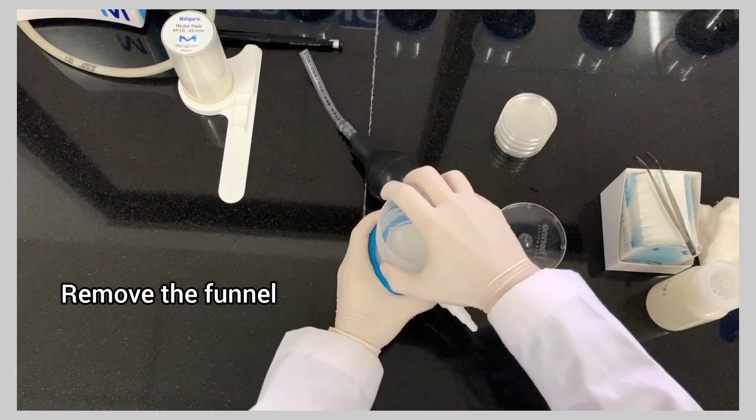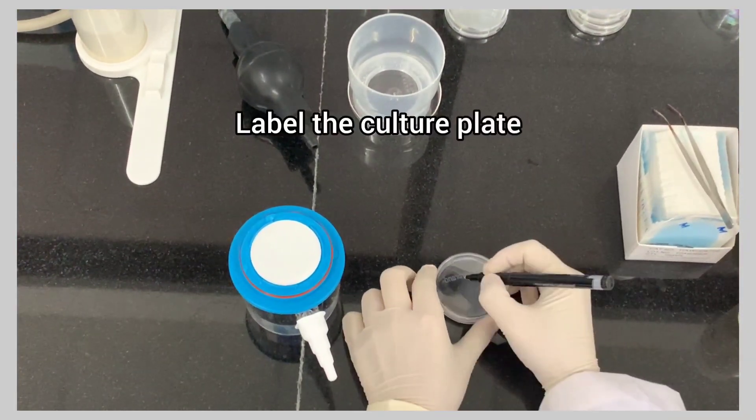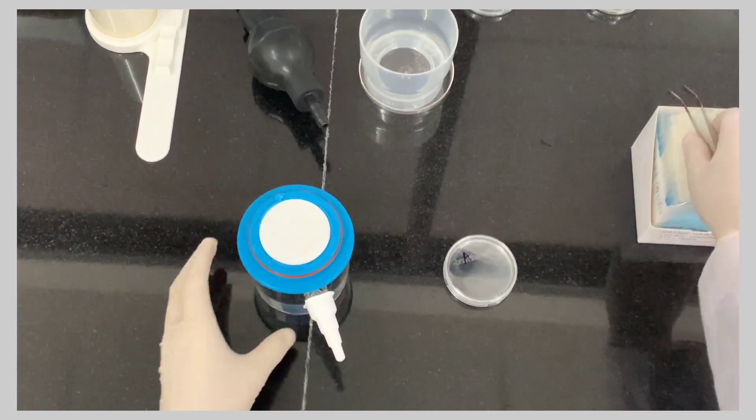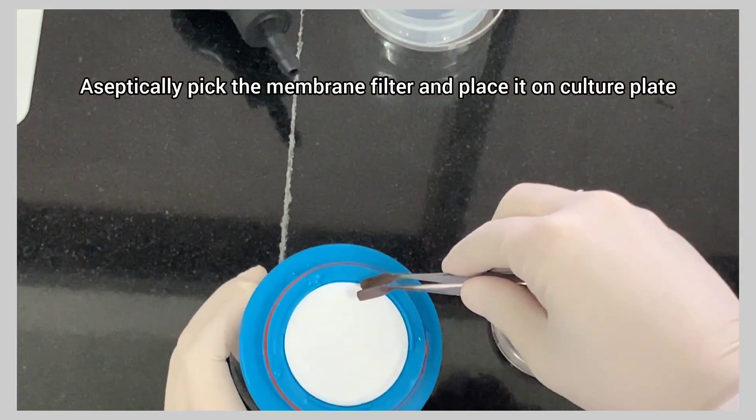Remove the funnel. Label the culture plate. Aseptically, pick the membrane filter and place it on culture plate.